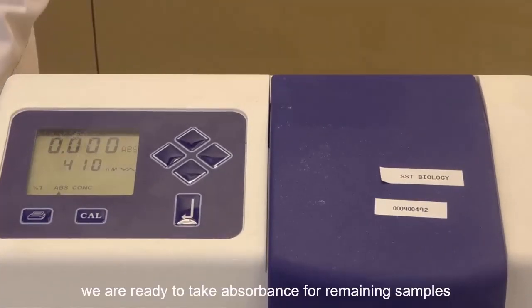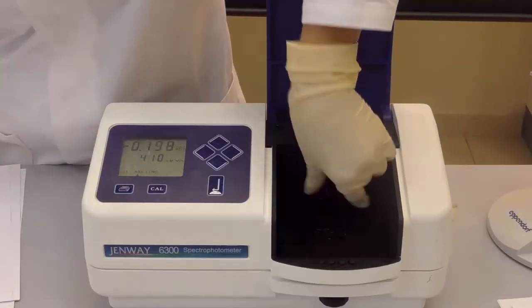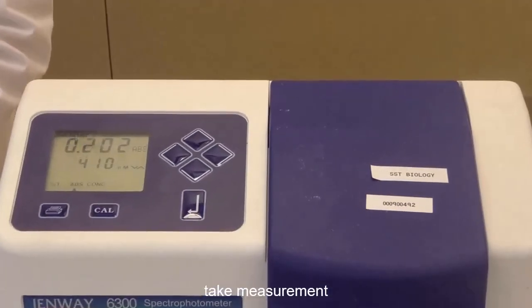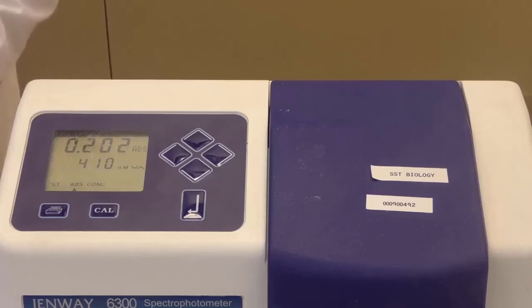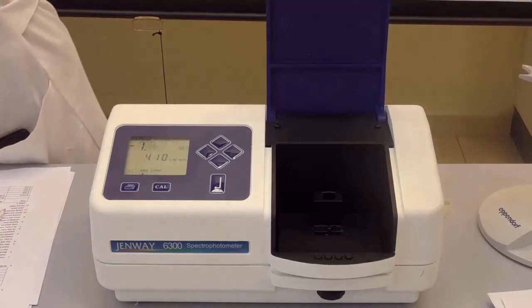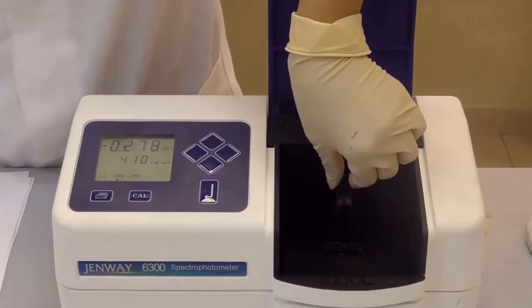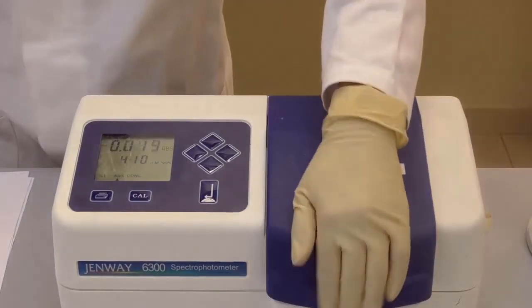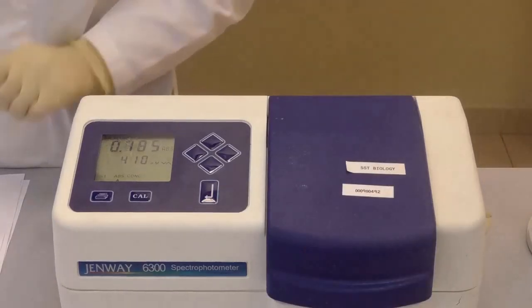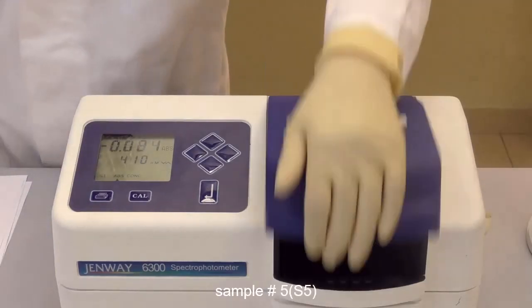Now measure the absorbance for the remaining samples: S2, S3, S4, and finally the highest concentration, S5.